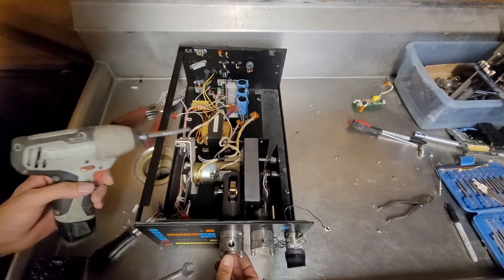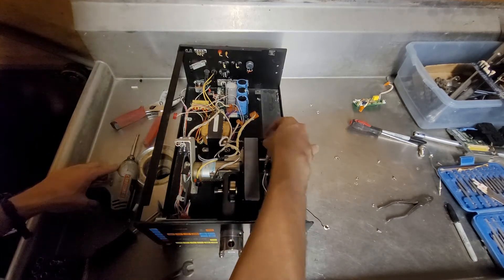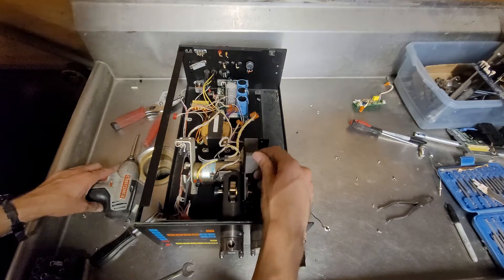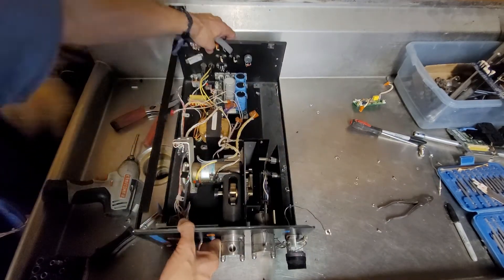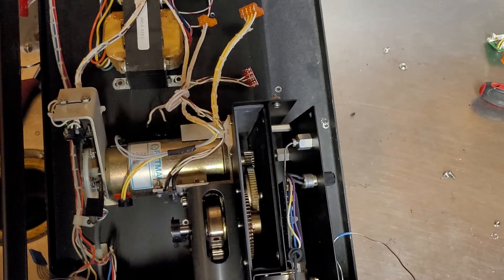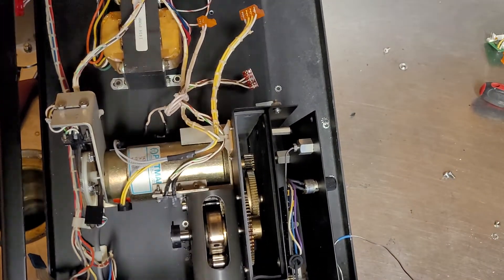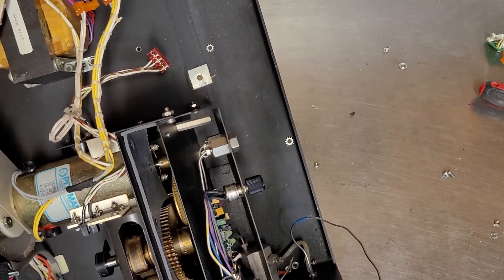Still not certain how to tackle this pump. There's a nice little bit of foam in there. Some gears in there — I was wondering how that connected to that flywheel.